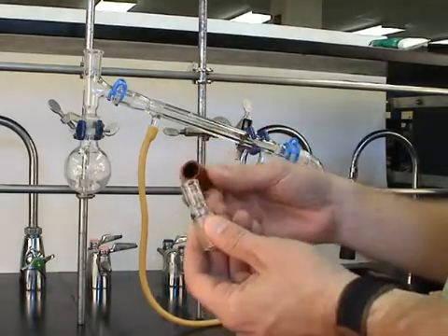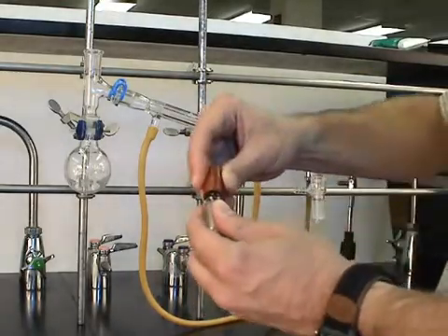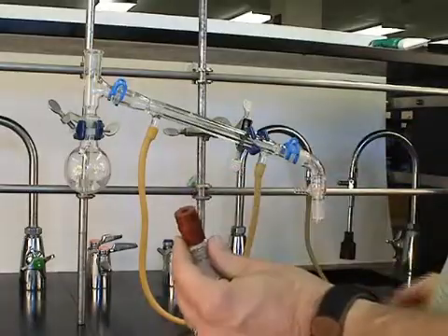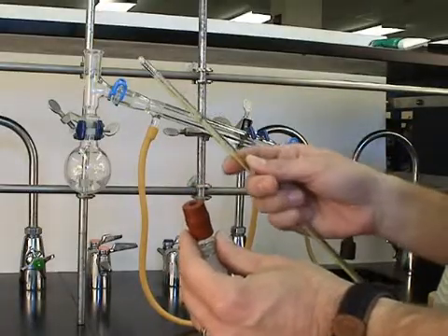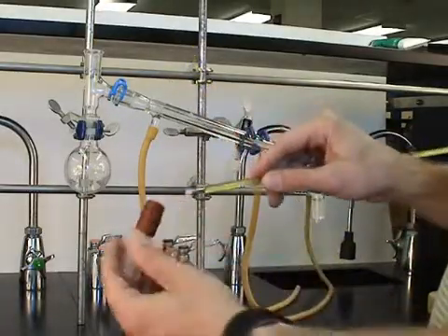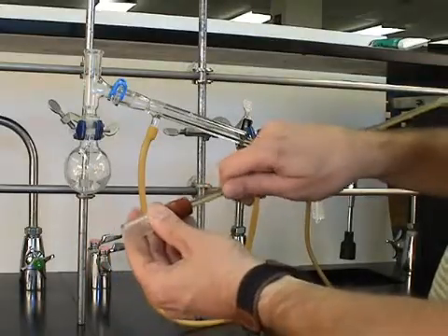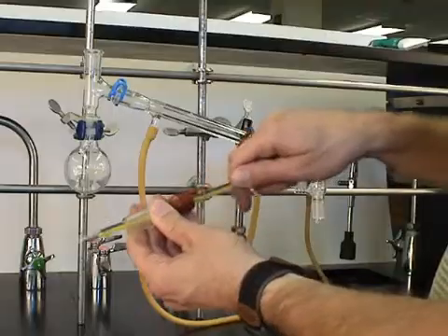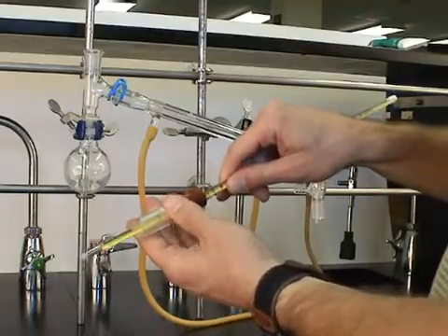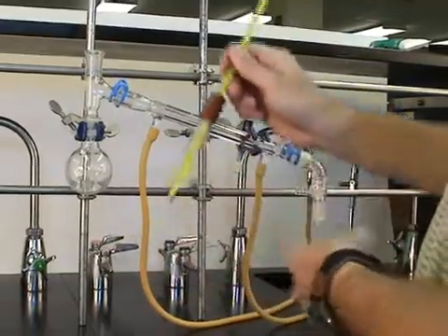Next, a thermometer adapter and the rubber gasket are assembled. And then carefully the thermometer is inserted through the rubber adapter using small pushes. And get it roughly in position.